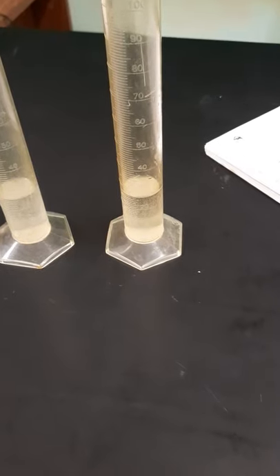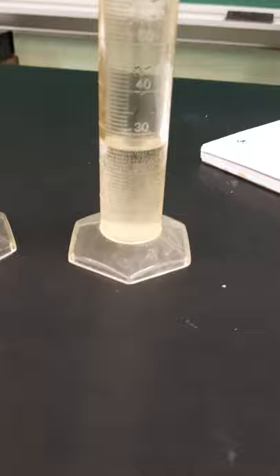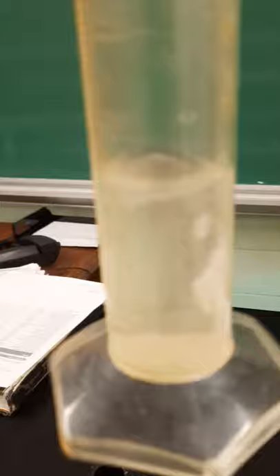What we have here are two graduated cylinders filled with water. There are exactly 25 milliliters of water in each graduated cylinder.